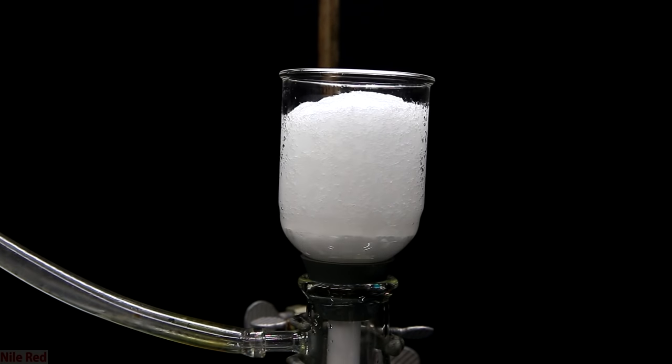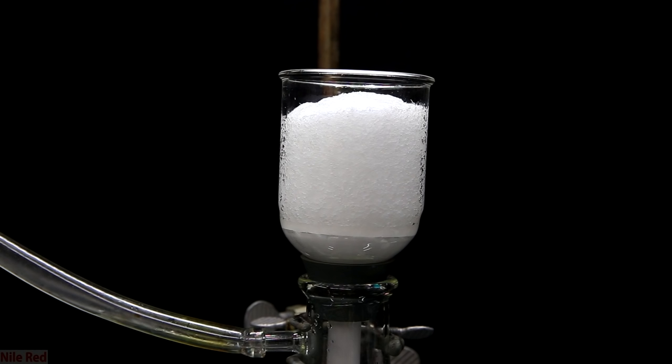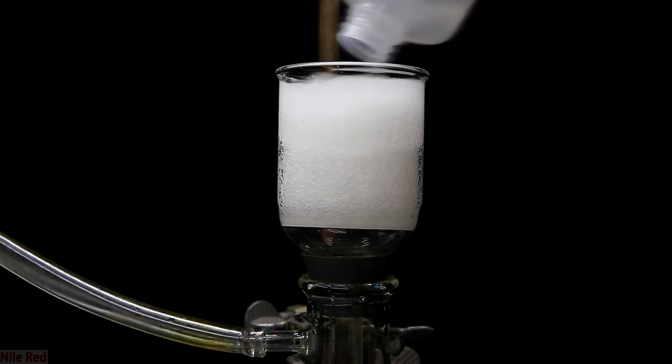After pulling the vacuum though this time, you can see that the filter is pretty full to the top with solid. So, unfortunately, there was too much to do it in one run and we're going to have to carry out two separate filtration steps.